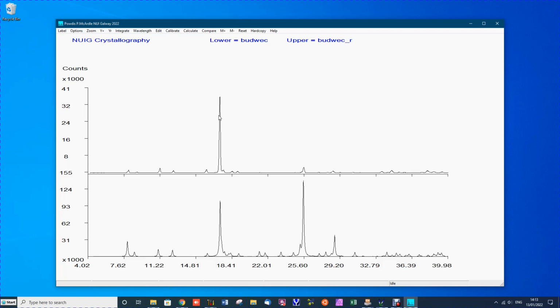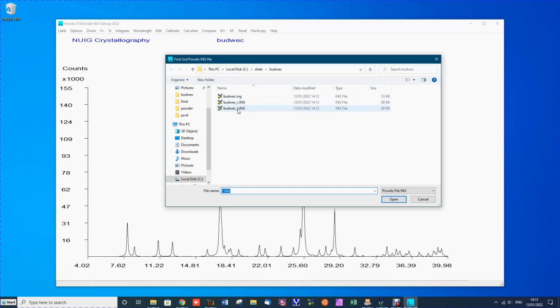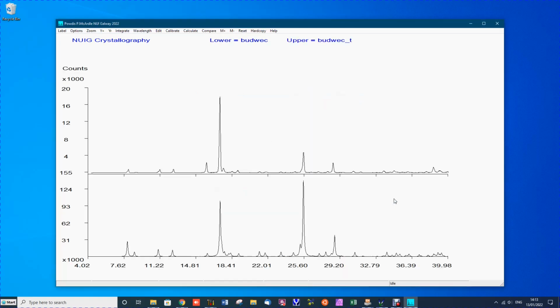So we can see this peak dominates, and it's the one we label bar 402. Now we can remove this and compare it to the transmission mode spectrum quite easily by just using reset to go back and compare, and this time pick the transmission mode one, and we see that more of the peaks are observed in the transmission mode than in reflection mode.